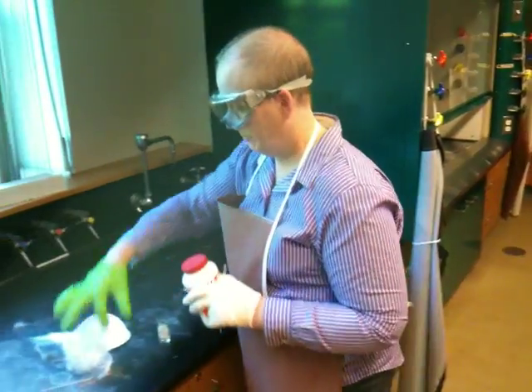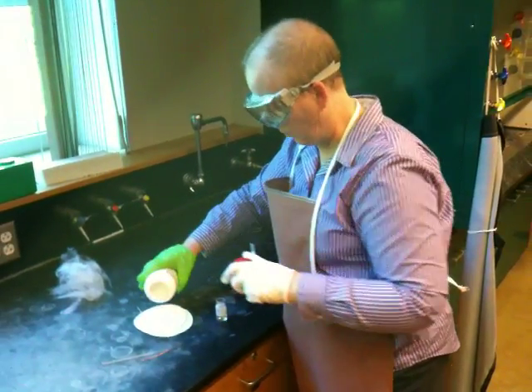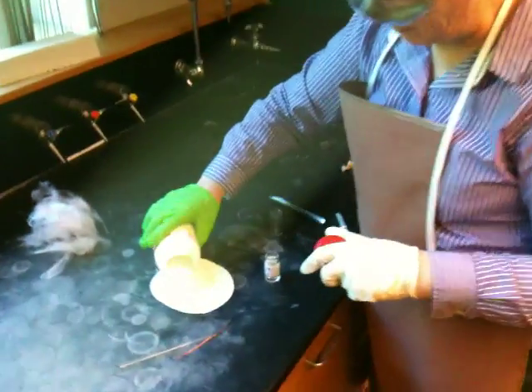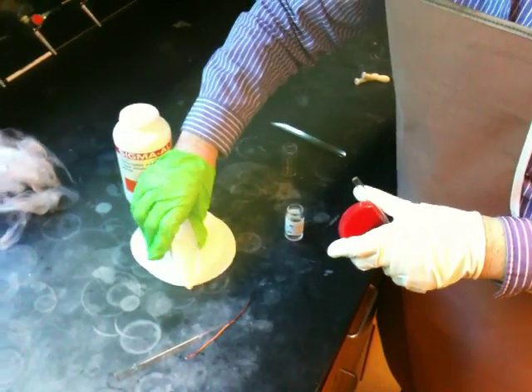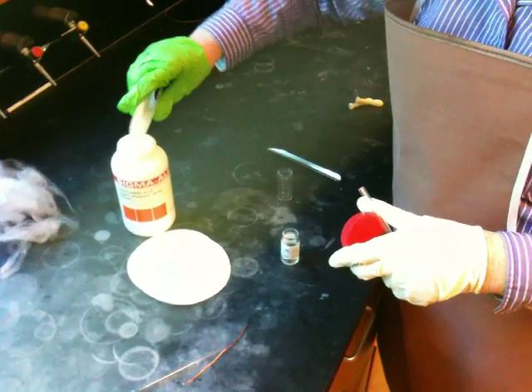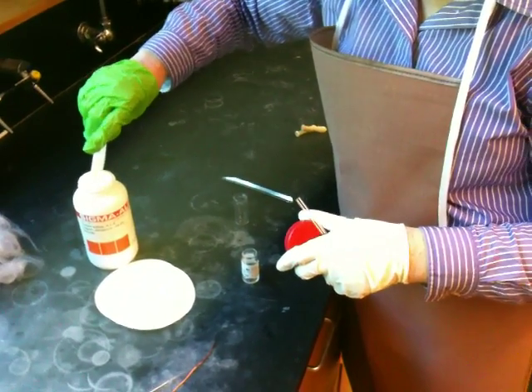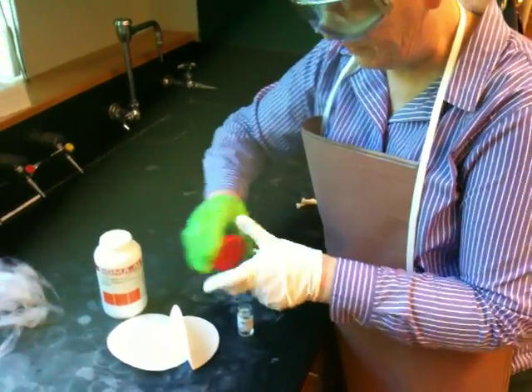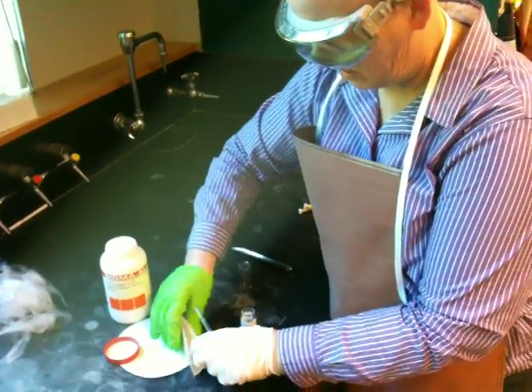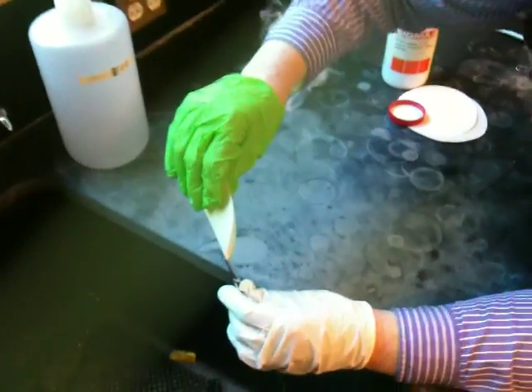Okay. Now, I'm going to take a little bit of drying agent and just pour it out. And my problem is going to be, how am I going to get the drying agent into the tube? I'm going to take less than that. I don't need a lot. We're going to try to put about 2 centimeters or about 1 inch of material in. Okay. I'm going to do this over the sink because I am going to spill it. This drying agent is harmless.